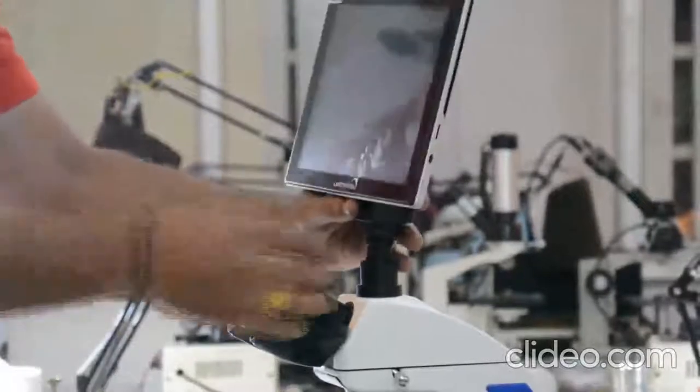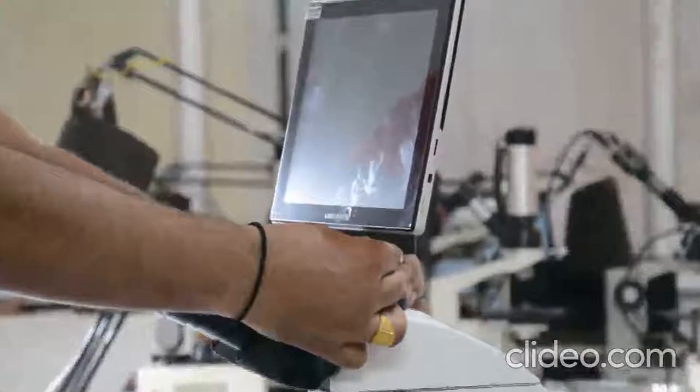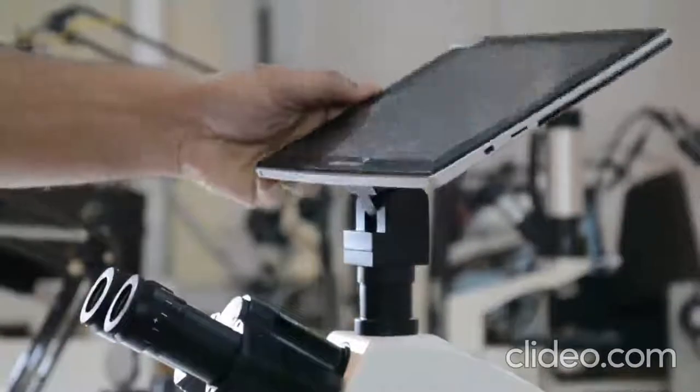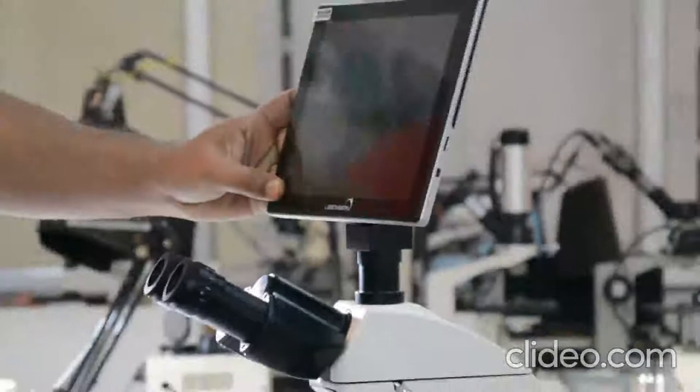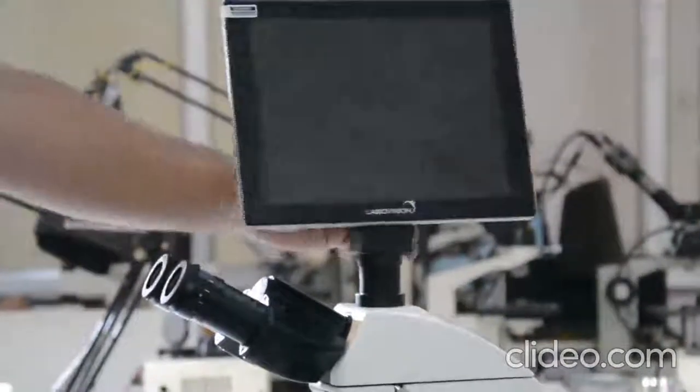Now we will place the LCD screen. You have to slightly screw the plug. Now it is completely rotatable, as you can see. You can move it to any direction. It is a 360 degree movement.